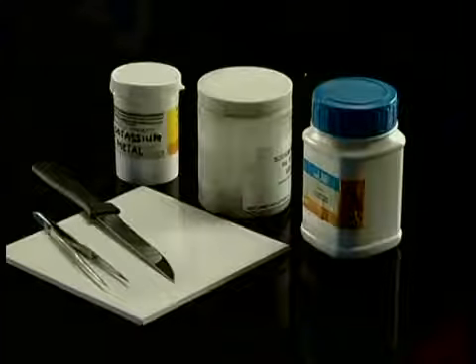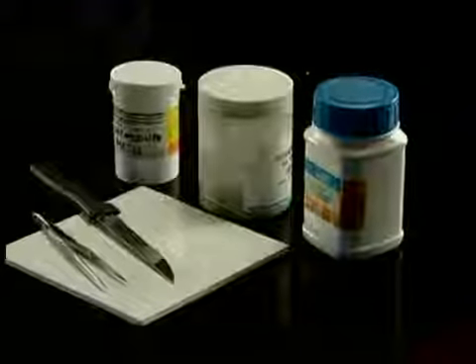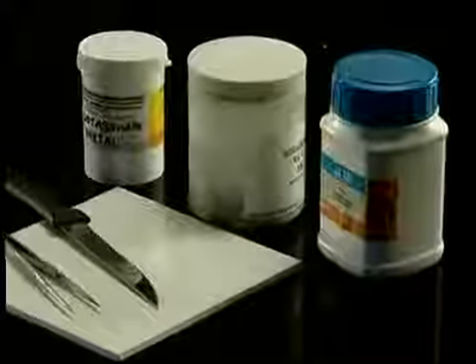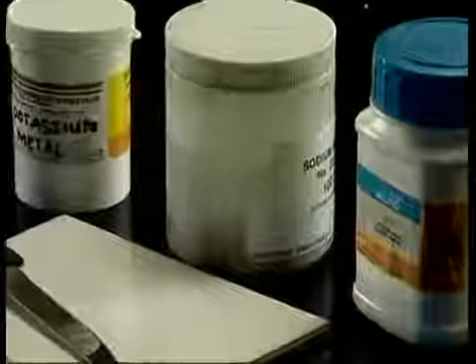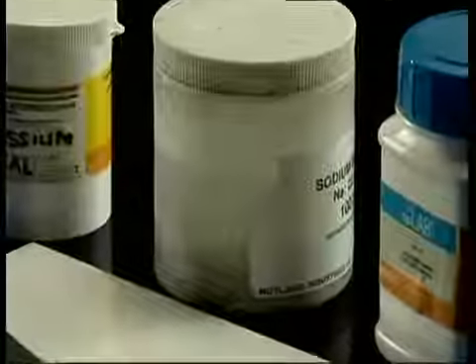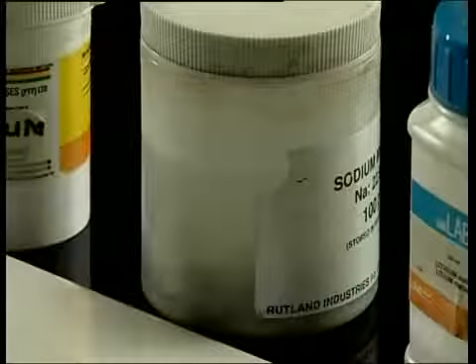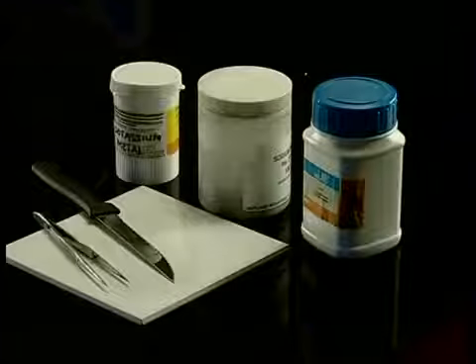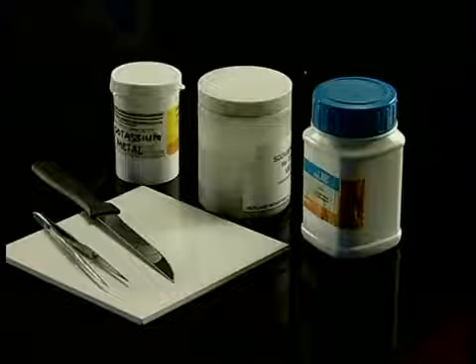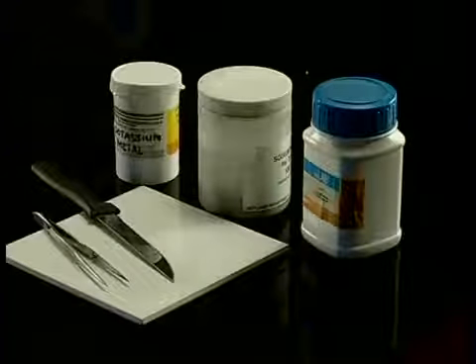Have a closer look at the elements we will be using today. The alkali metals react spontaneously with water and with air. They must be stored in a waterless, airless container. They are stored in paraffin. When using the metals for experiments, they must be handled with care. Always use tongs or tweezers to hold them. Under no circumstances must the metals be handled with bare hands. They can be cut using a scalpel or a sharp knife on a hard surface.